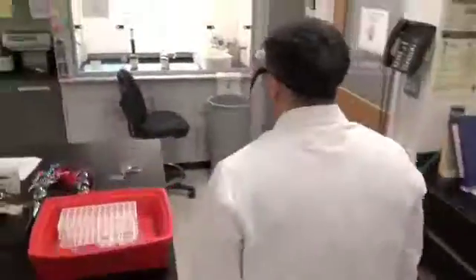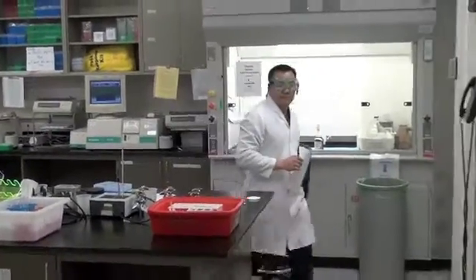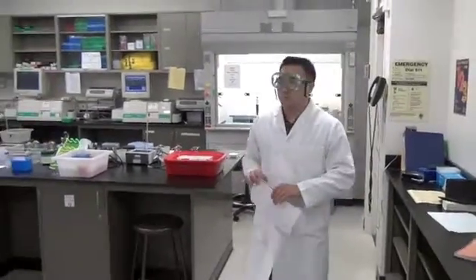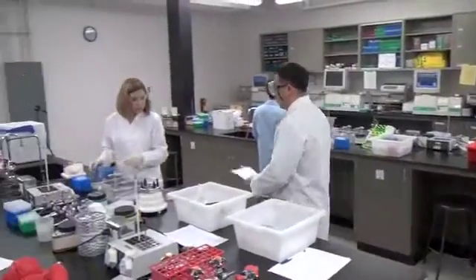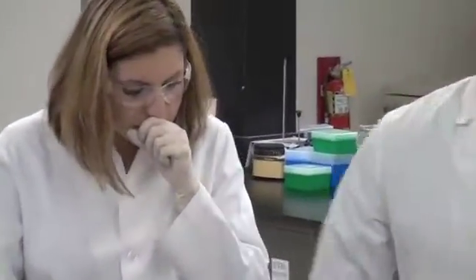That is no way to treat your assay team. Certainly, it's not a good sign to lose your professionalism when lab work gets stressful. Well, it looks like her results are in. Oh, I think it's bad news. She doesn't look too happy.